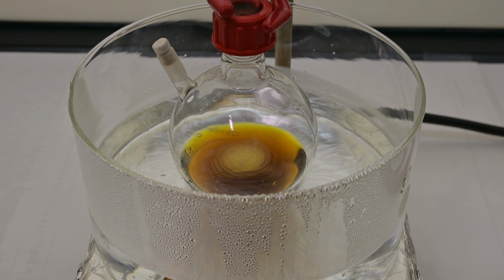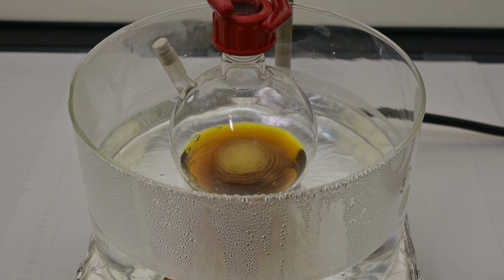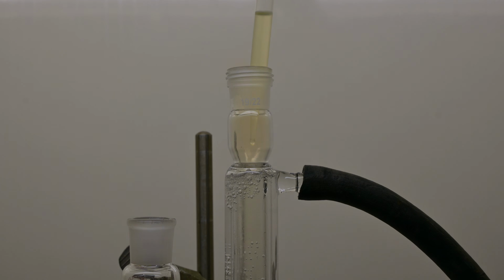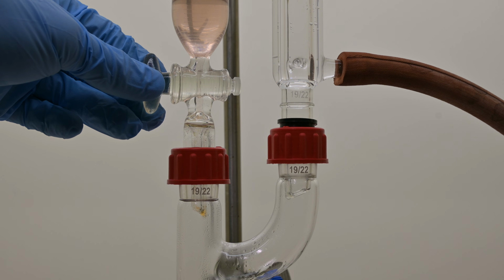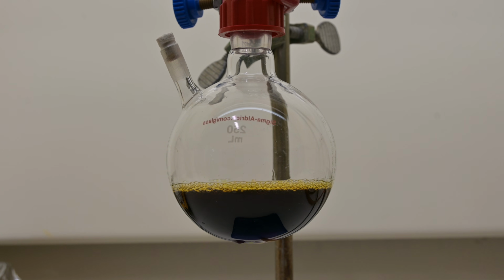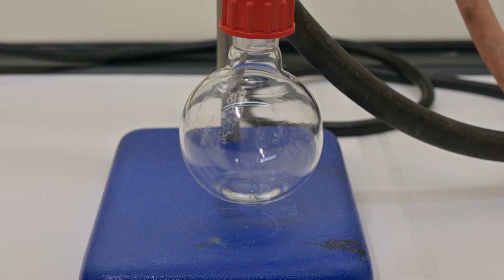The gentle reflux, which is controlled heating, drives the reaction forward, and the slow addition helps prevent any unwanted side reactions. After that half addition, add another 2 milliliters of n-butyl nitrite through the condenser. Then continue adding the remaining anthranilic acid solution dropwise over another 15 minutes. Once we have it all added, the flask is taken off the steam bath. I then remove the reaction solvent.